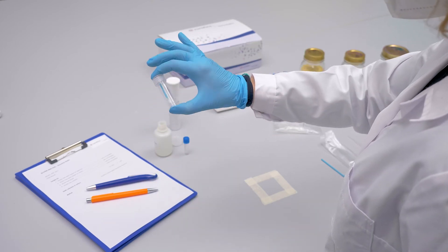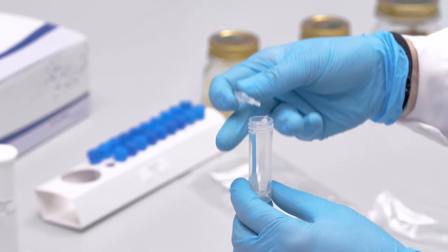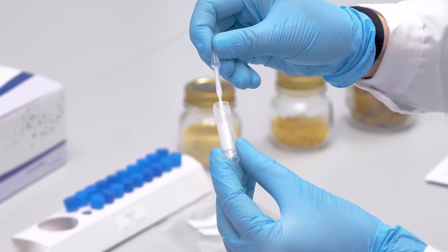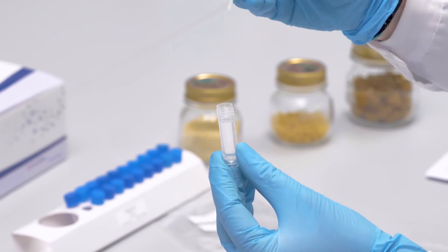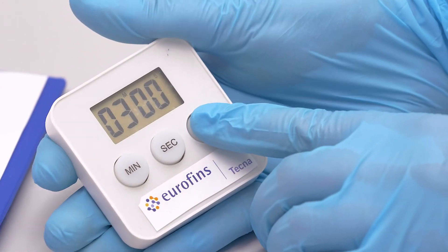Shake for one minute and transfer 300 microliters of the content into the reaction vial. Close the tube and shake for 15 seconds. Incubate for three minutes.